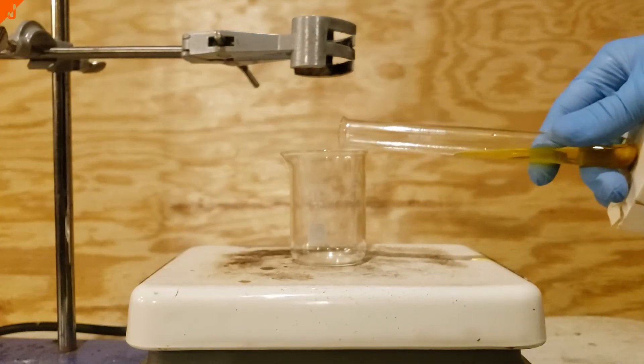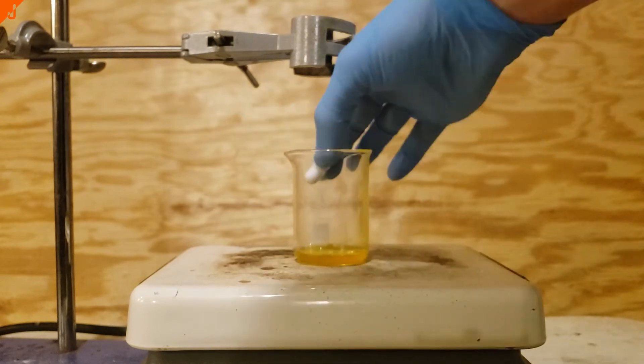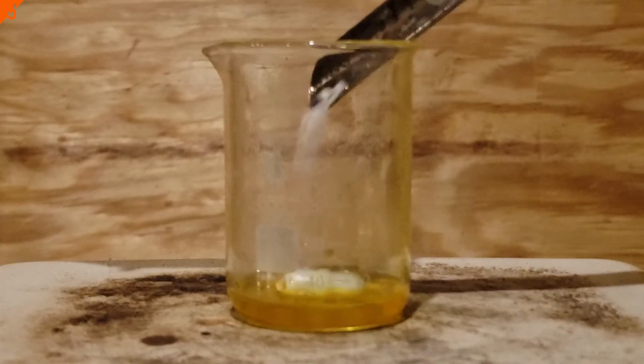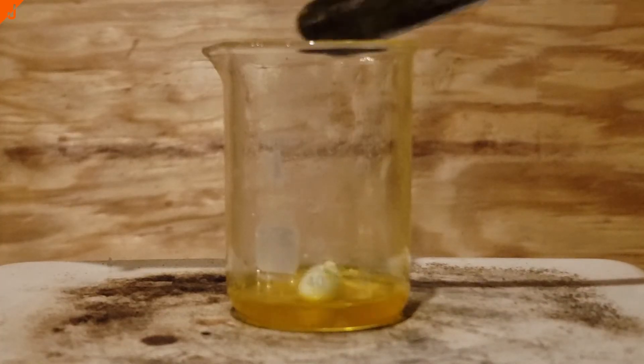To this beaker, I added a larger stir bar and I began stirring it. I then began adding a small amount of boric acid to the solution and let everything dissolve.